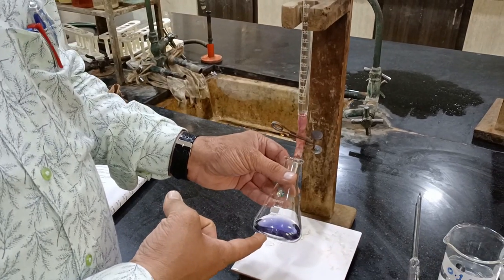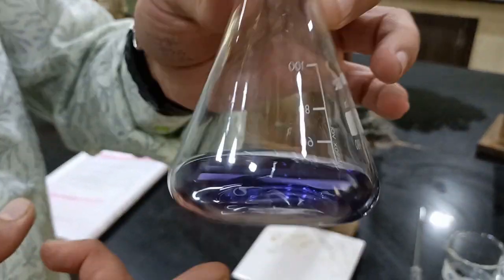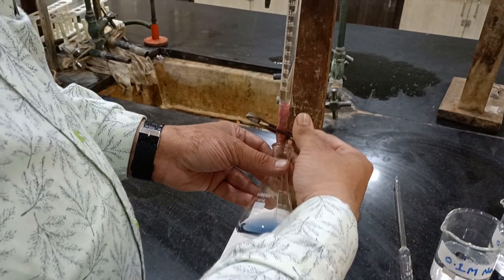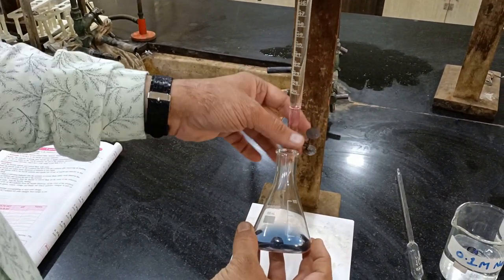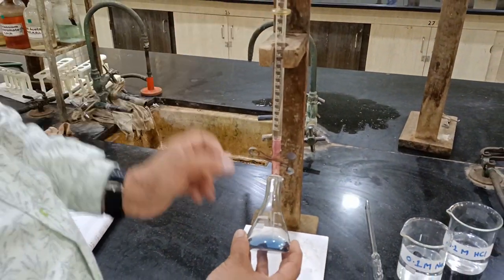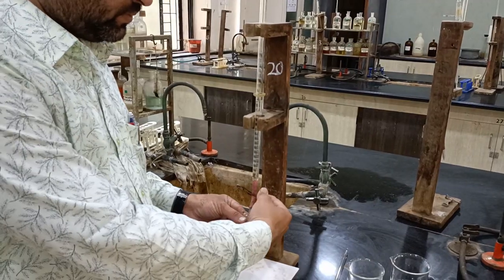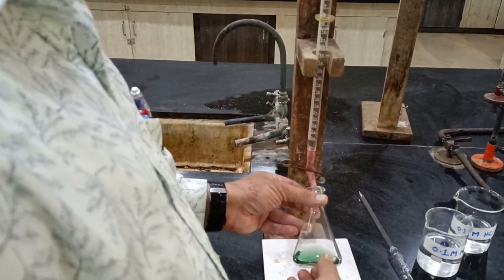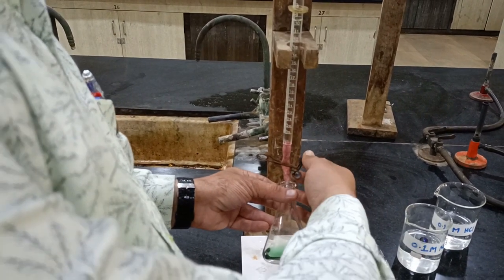First we get the indigo color, that is an ink color. Are you seeing this? Yes. After addition, we get the blue color, that is, the NaOH solution turns blue on adding some amount of HCl solution. So this is the blue solution. After adding 2 to 3 drops of the HCl solution, the blue solution turns into a green solution. Let's start for the next.